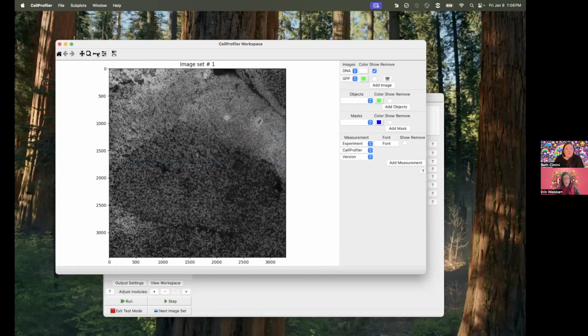And so you could imagine differences in intensity coming from different sources. This doesn't look like unequal illumination. If it were, I would send Susan or anybody to our episode about illumination correction. This doesn't look like that. This looks like these nuclei are maybe just smaller or brighter. So these are truly brighter and these are truly dimmer, but we actually want to treat them both the same.